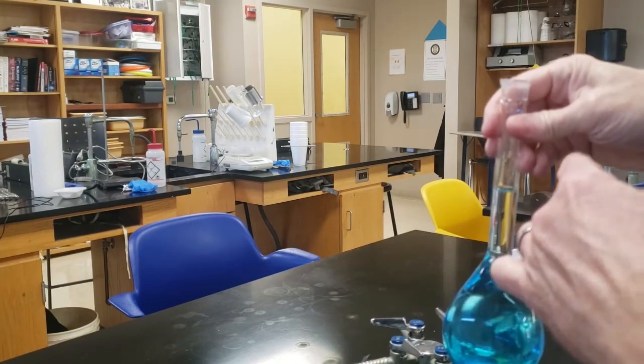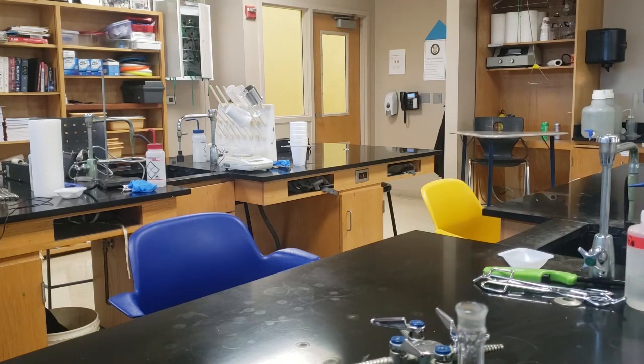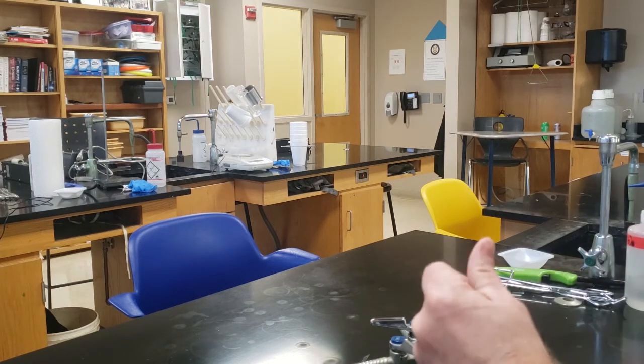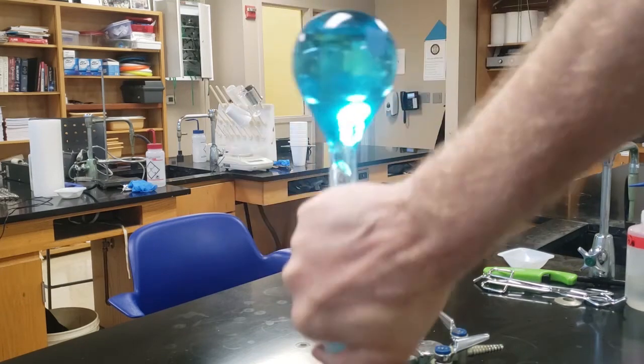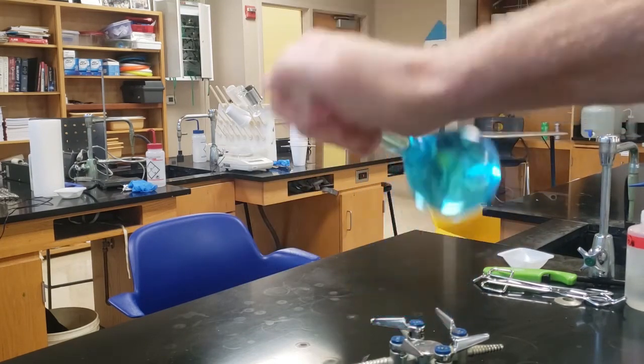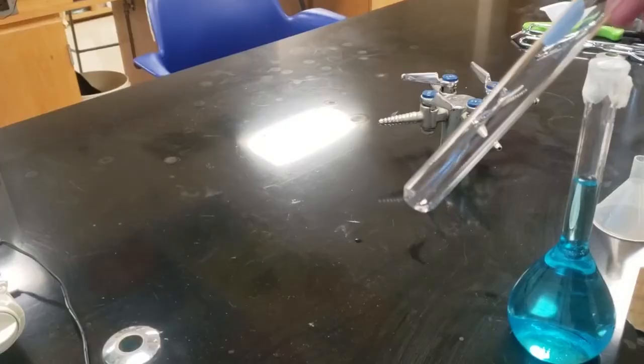There's the line, and it curves. And so the bottom of the curve is touching the line, not the middle, not the top. Now, the top part is actually mostly water, and the bottom part is mostly the solution. So we've still got to stir it up one more time, just do a couple of ins and outs like this, and that way it's completely uniform or the same.